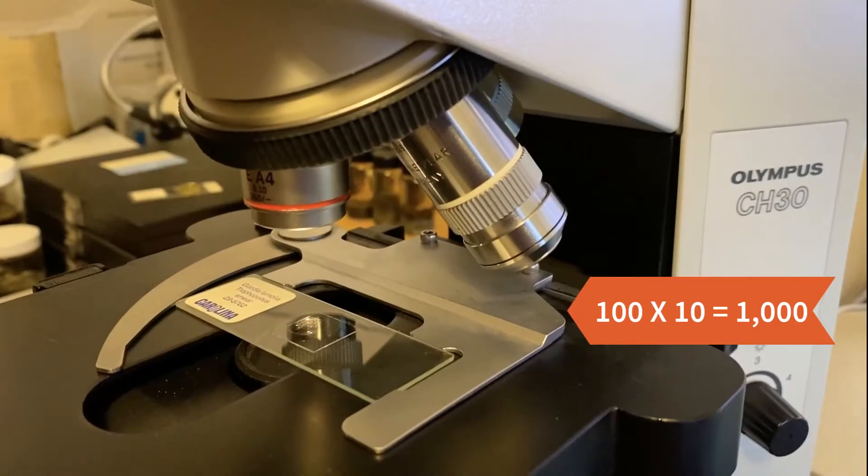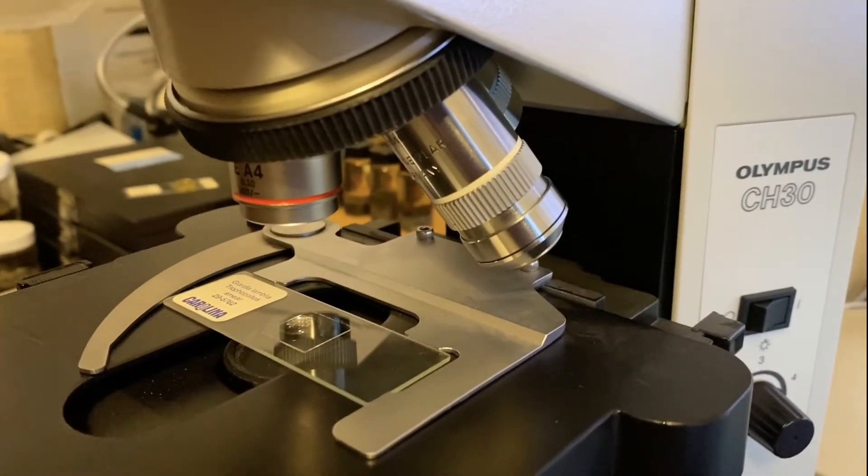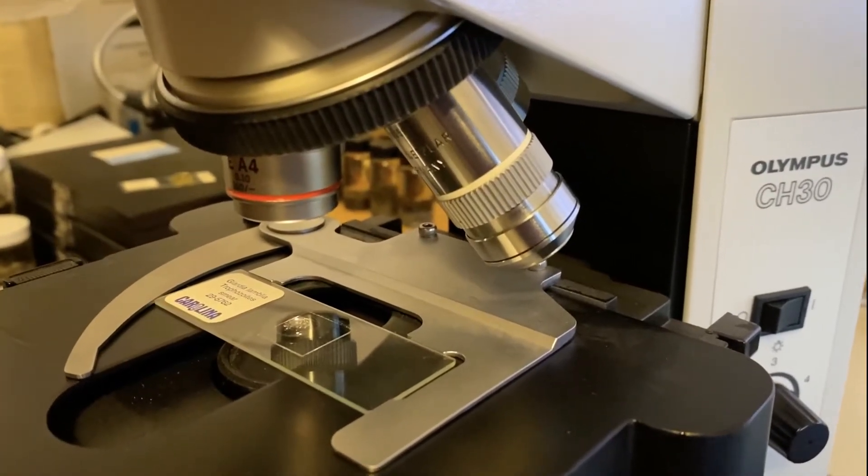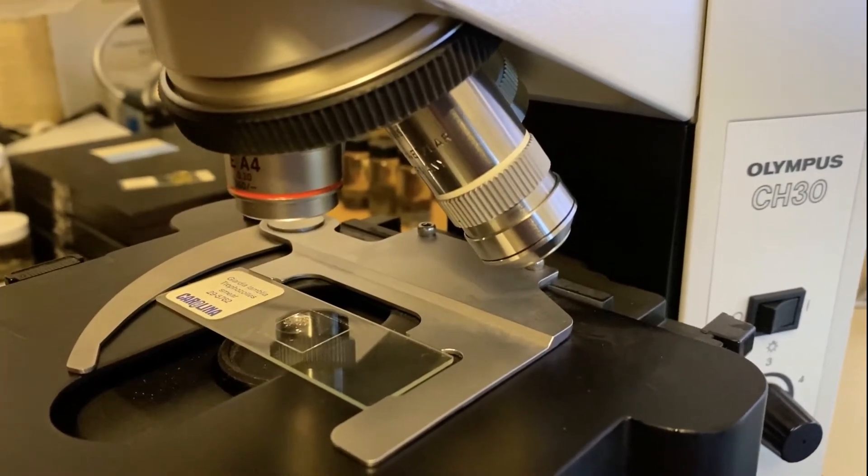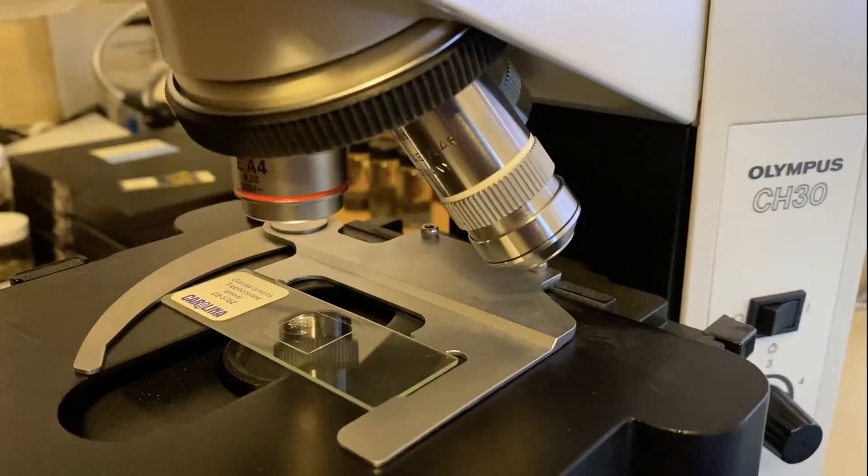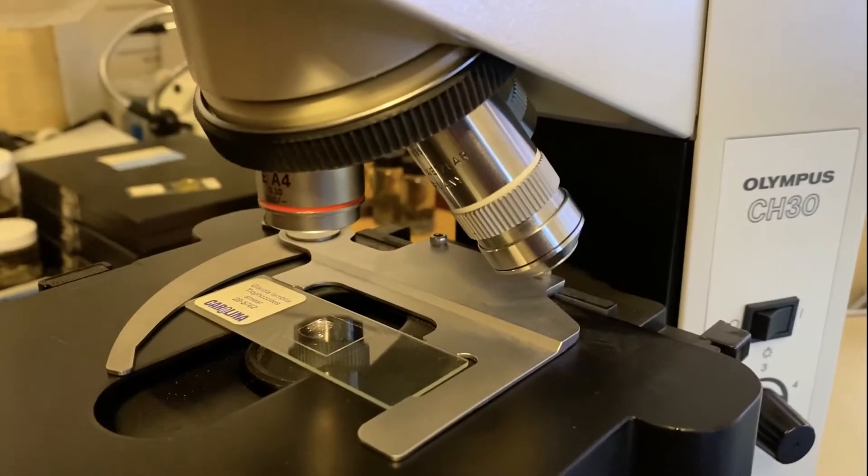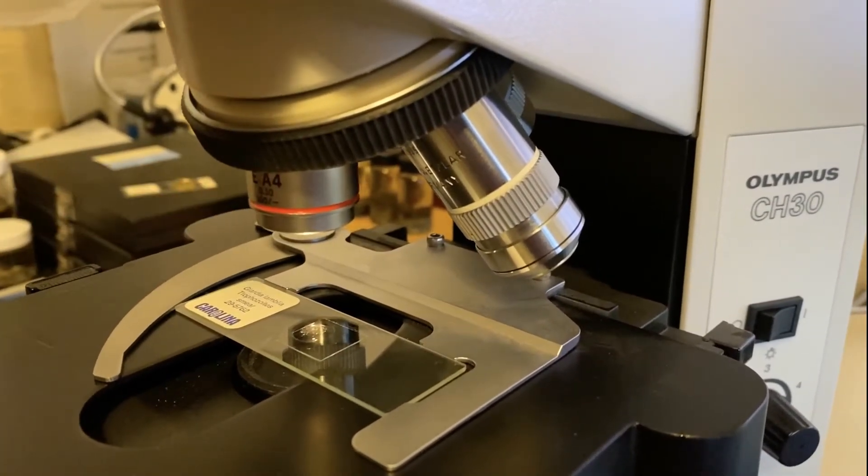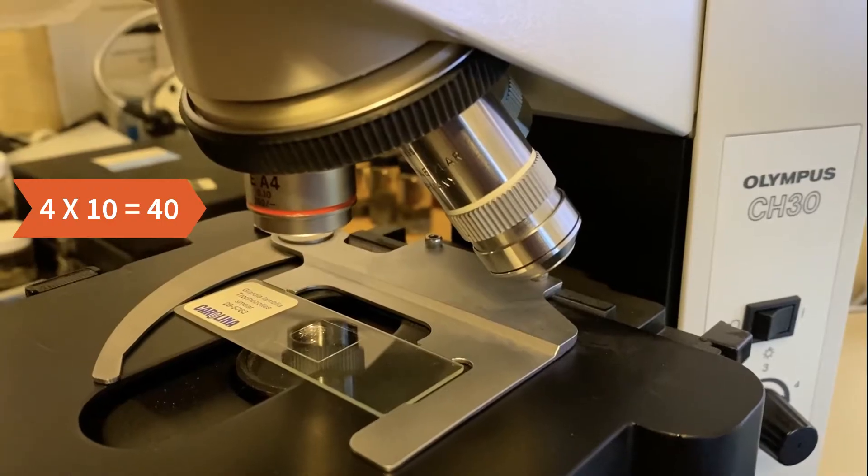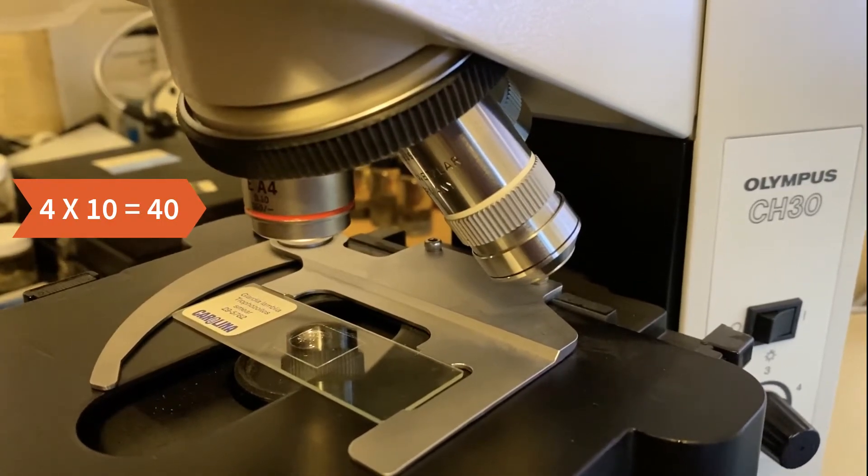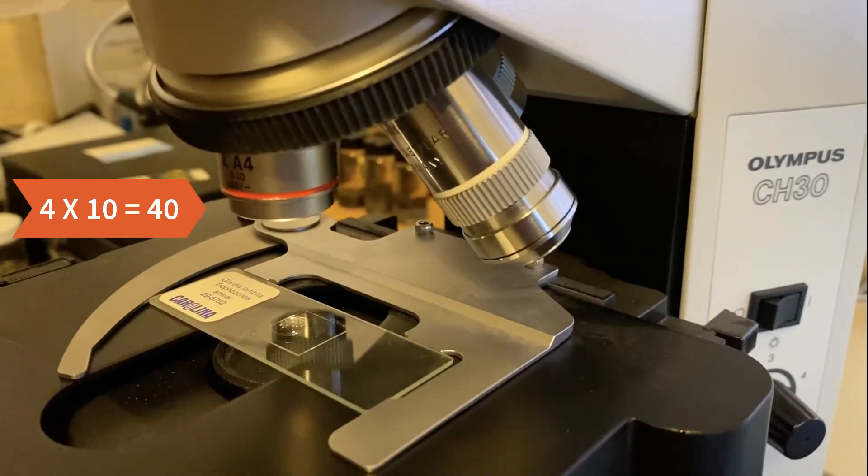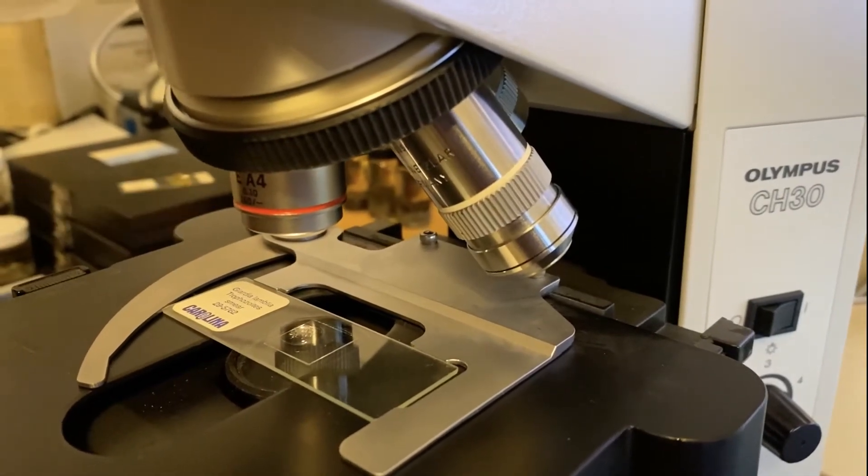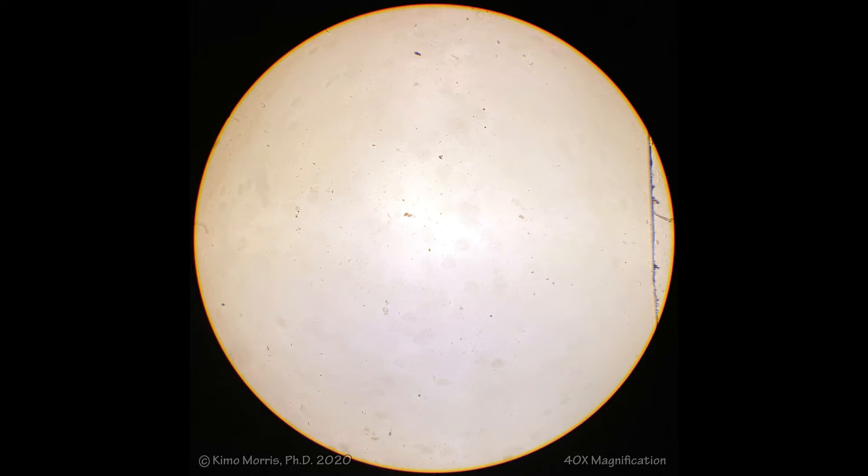In order to properly focus down to that high magnification, you still have to follow all of the safe microscope practices so that you don't break the slide. I'm going to start out first with the scanning power, which is four times. So I'm viewing it at 40 times magnification if you multiply this times the eyepiece, and you are not going to be able to see Giardia at all under this magnification.